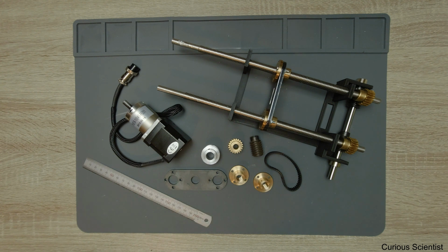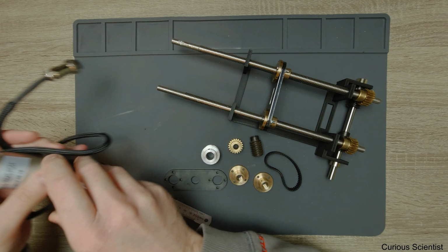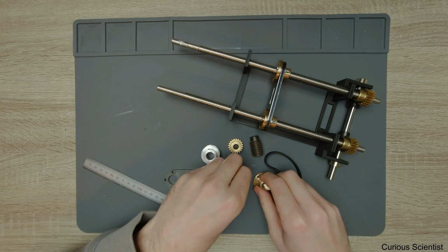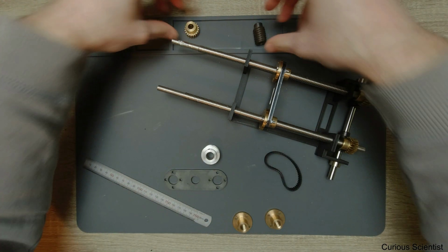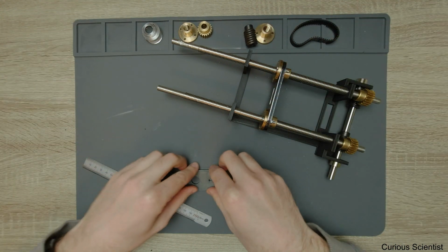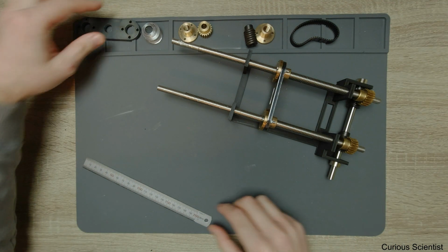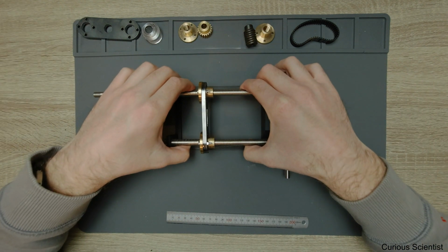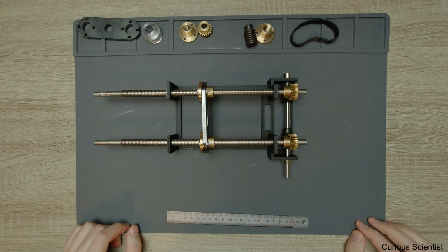So as you can see, I put a lot of parts on this table here, and I will show you what is what. But first let's get rid of most of these things. So I just put aside this stepper motor. So we have a few parts here which are the same as in the old or recent part of this machine. But here is another thing which I recently made.